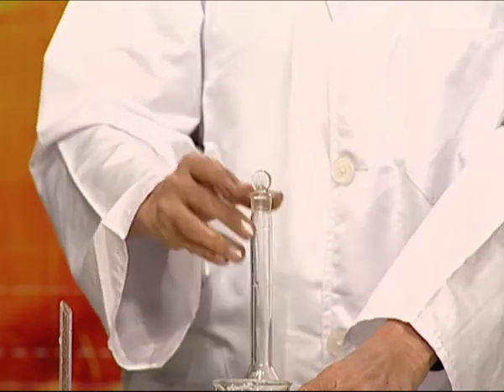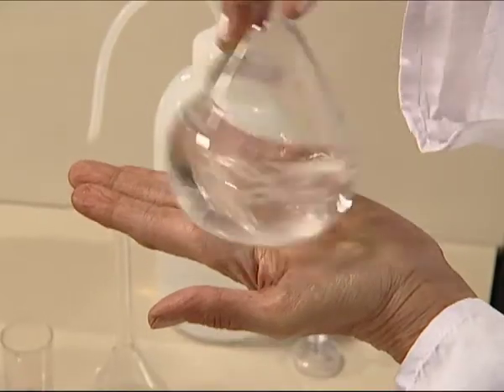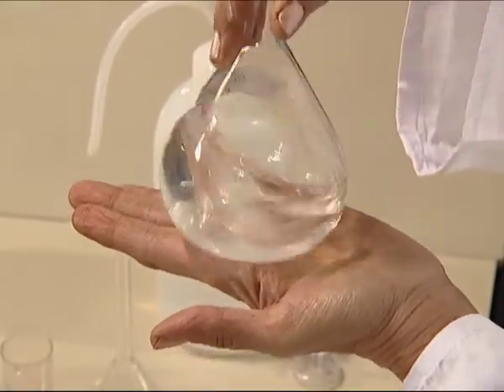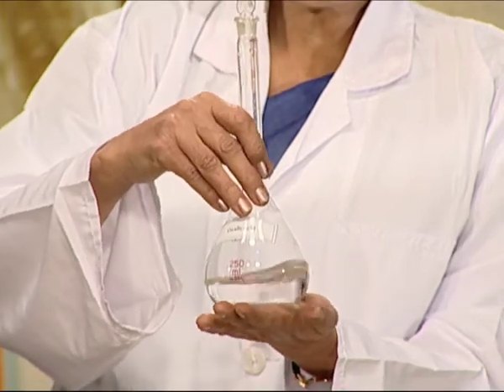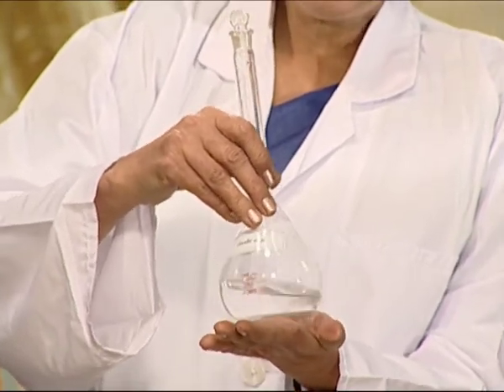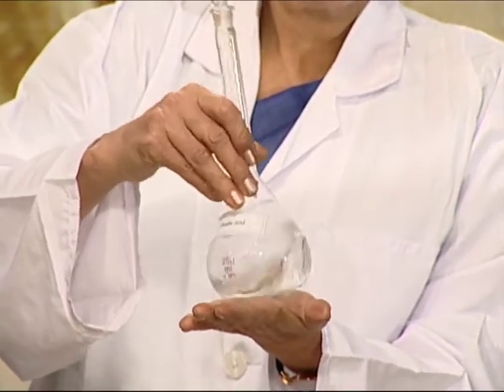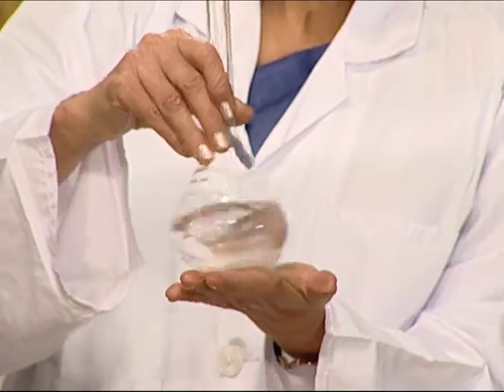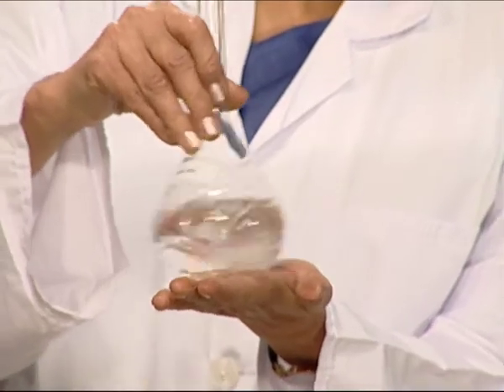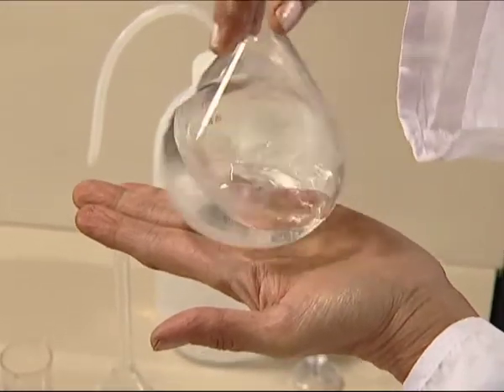Now we insert the stopper. We give the support of our palm to the standard flask and swirl it so that oxalic acid dissolves completely.